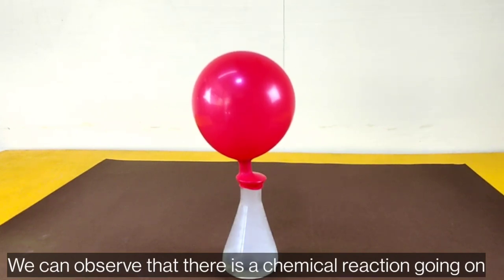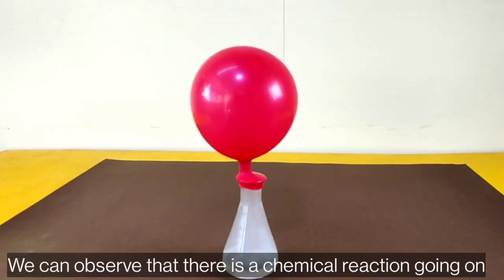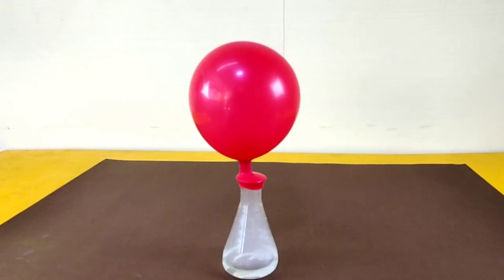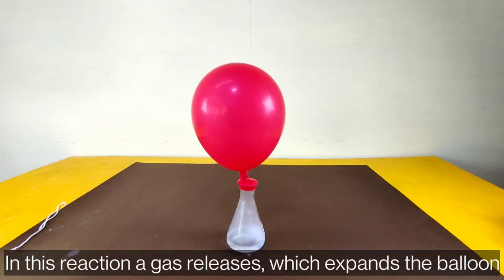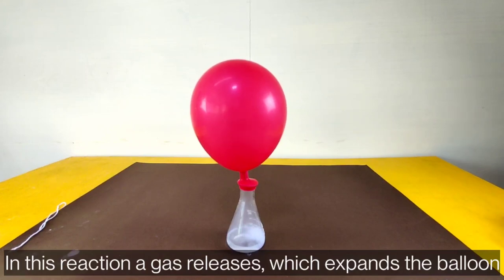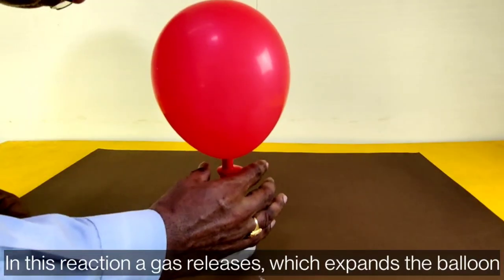We can observe that there is a chemical reaction going on. In this reaction, a gas is released which expands the balloon.